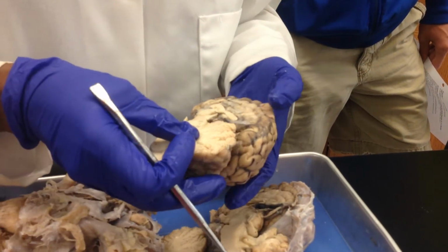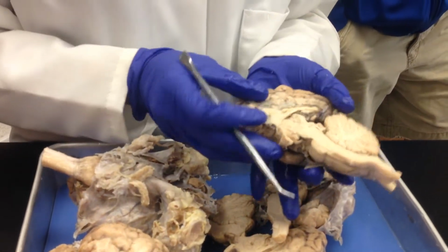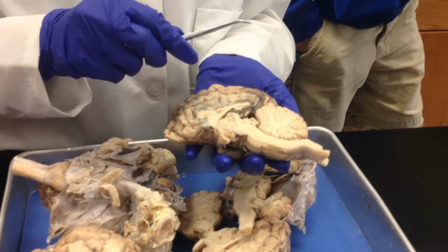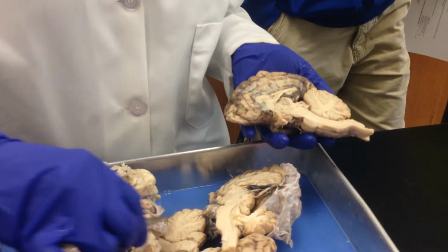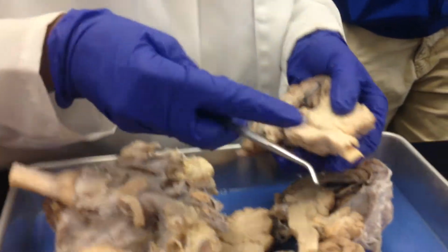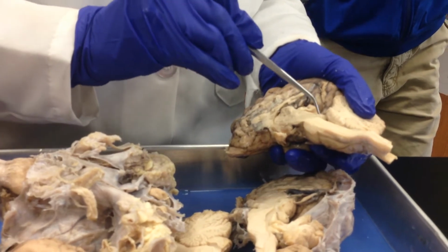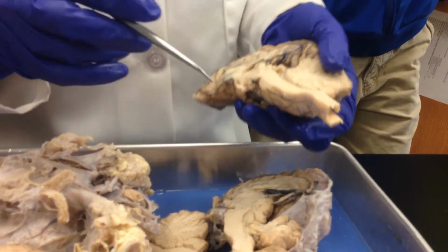Okay? Now, another structure, let's see here. Oh, I might as well finish off the sagittal section. Now, what is this structure I told you about? It looks like a tree. Arbor something. Arbor vitae, that's all your white matter. You can see that pretty clearly in all of your sagittal sections here. So, underneath that is your fourth ventricle. You see that? And this structure here that communicates the third ventricle and the fourth ventricle is going to be the cerebral aqueduct. That's the channel or the canal I was telling you about.